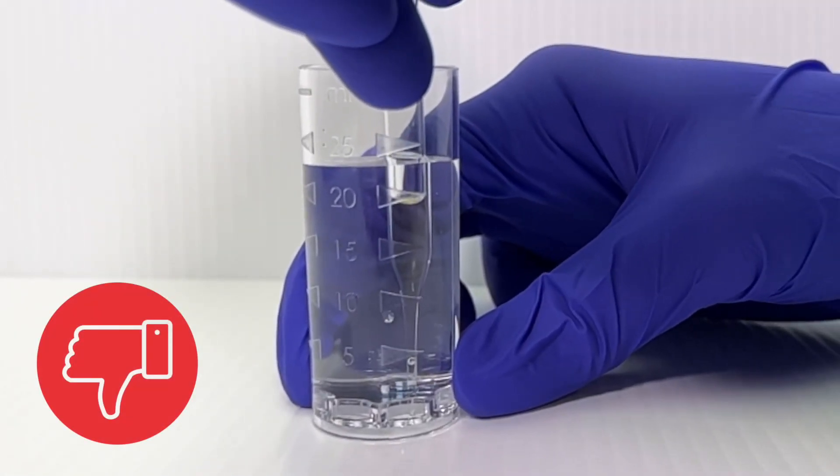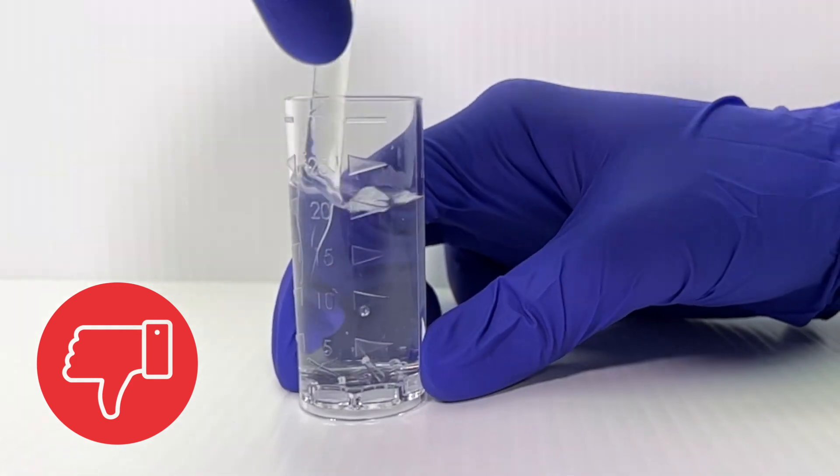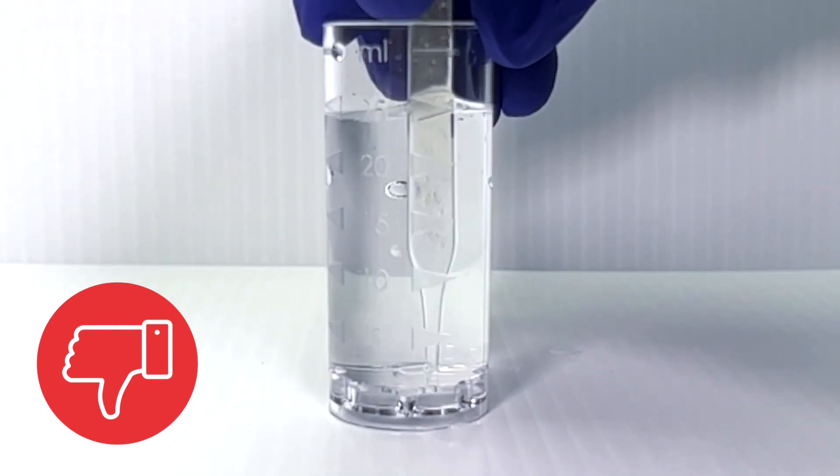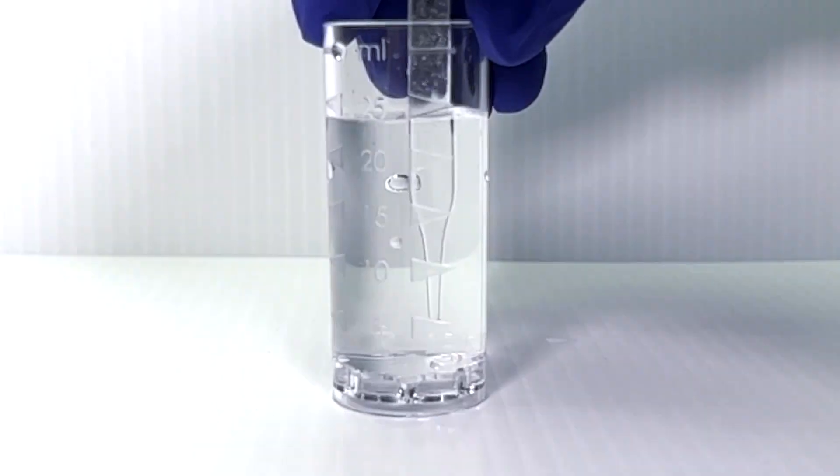Don't push the ampoule away from you. It is improper technique to apply downward pressure on the ampoule during the snapping process.